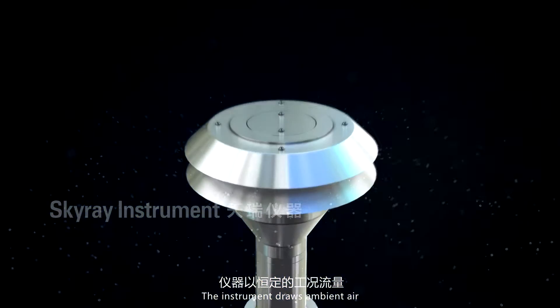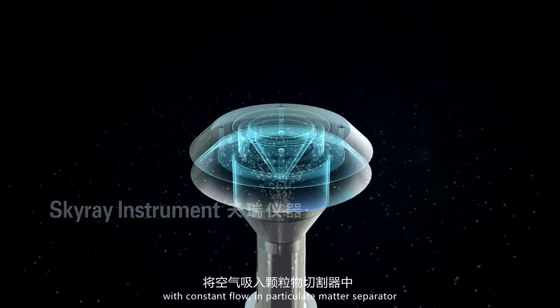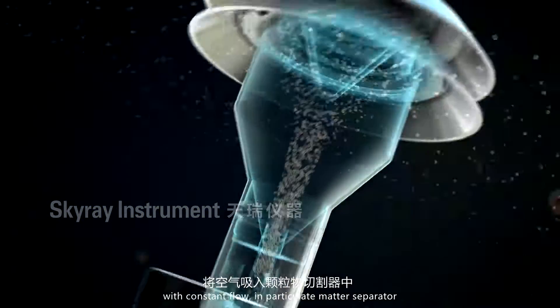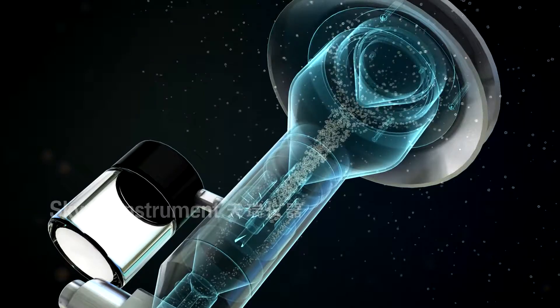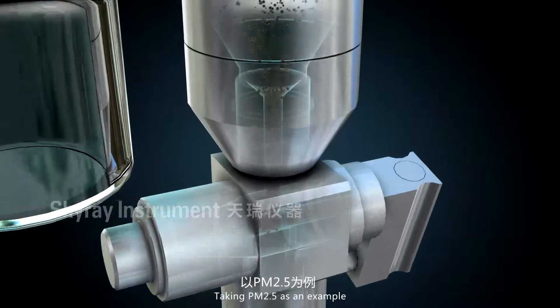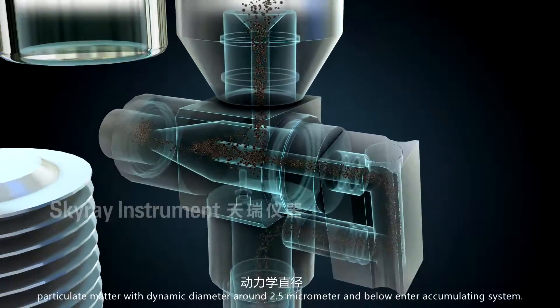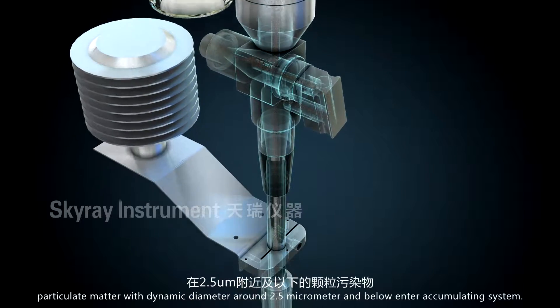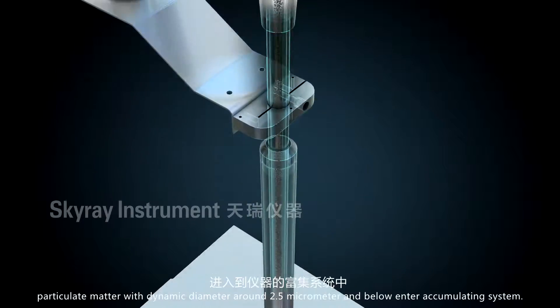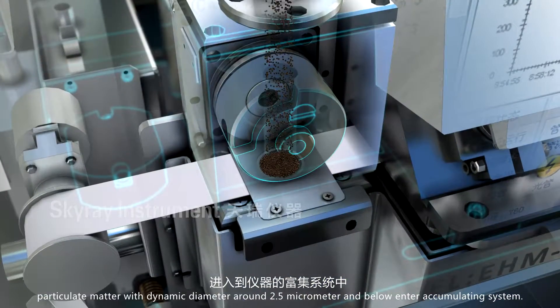The instrument draws ambient air with constant flow into a particulate matter separator. Taking PM2.5 as an example, particulate matter with a dynamic diameter around 2.5 micrometers and below enter the accumulating system.